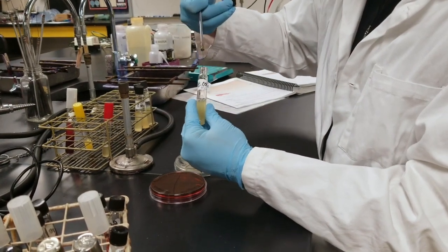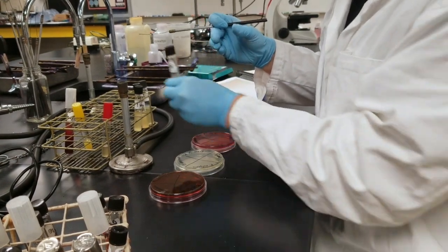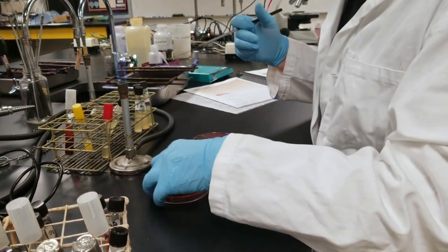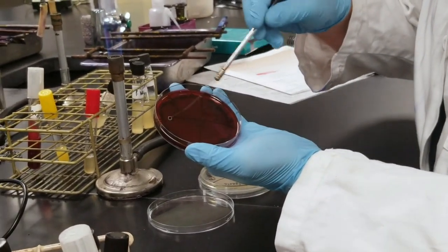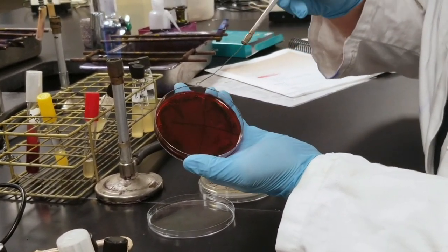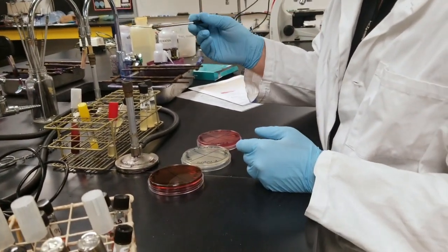Make sure it's mixed up when I take some out, flame, and then just plate a small line in my quadrant and flame between each bacteria.